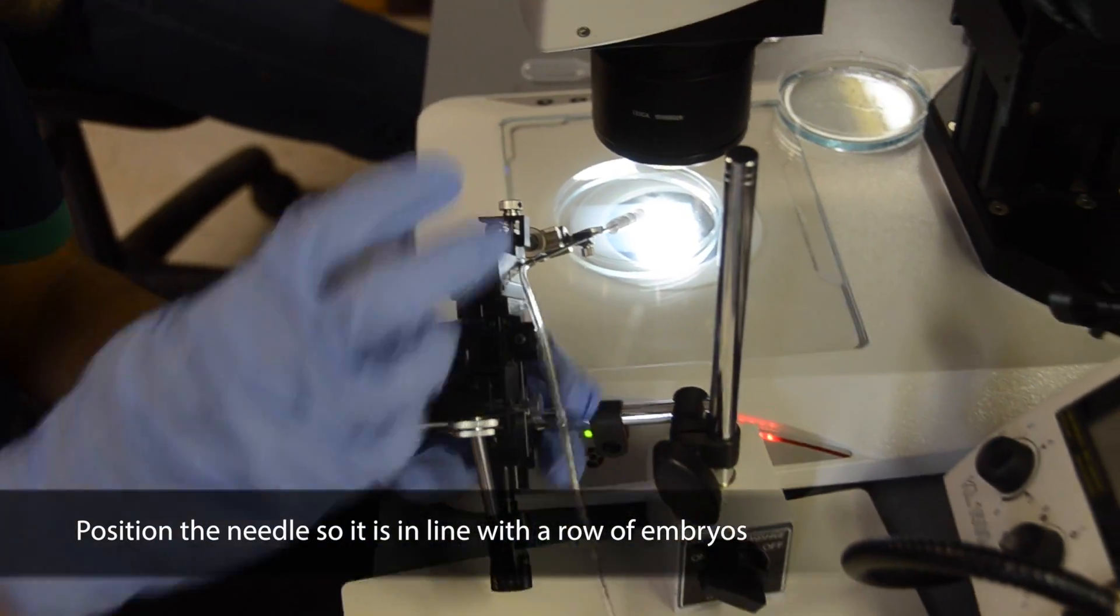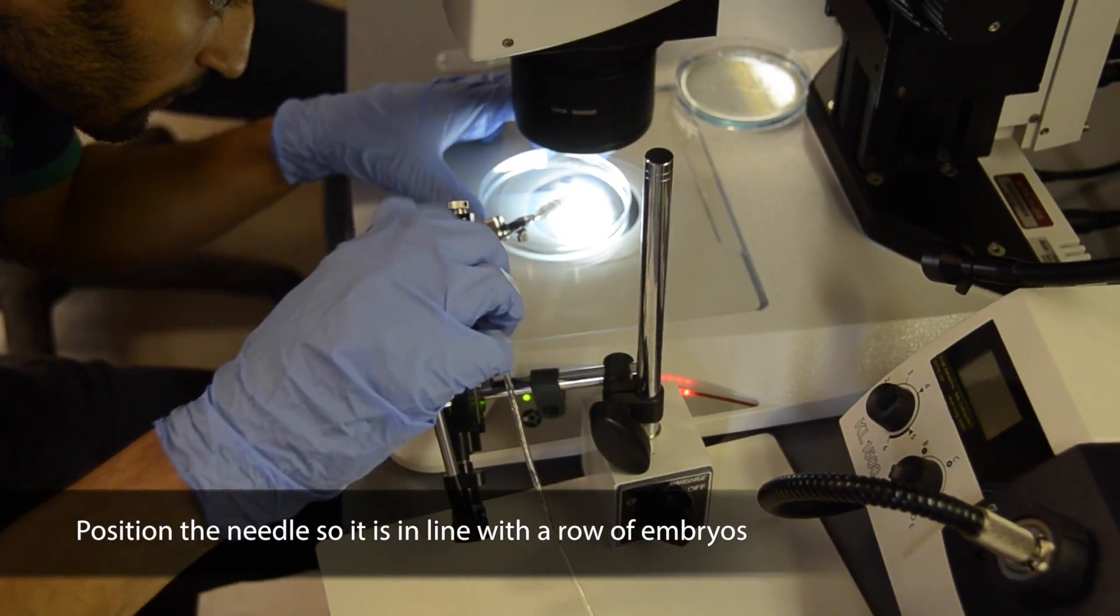Position the needle so that it is in line with a row of embryos. Use the knobs to raise and lower the needle.